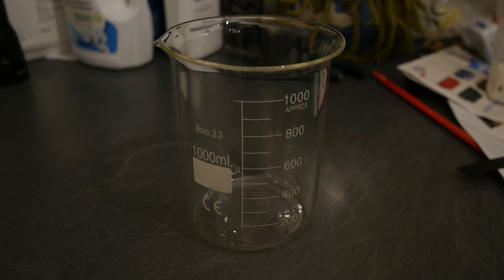To make 1 litre of the solution, add to a beaker 800 millilitres of very hot or preferably boiling water.